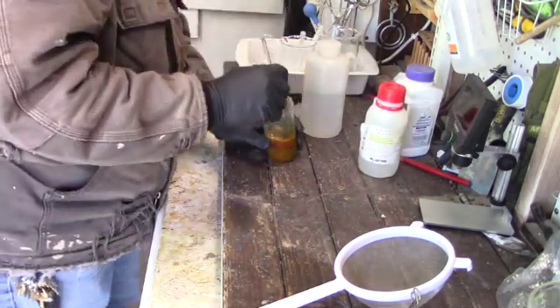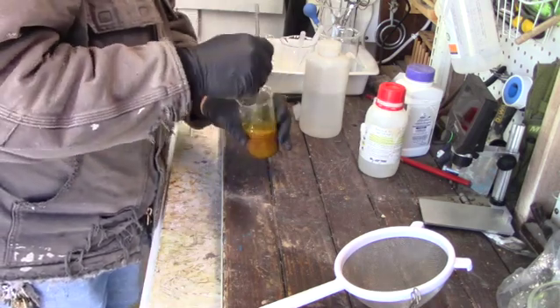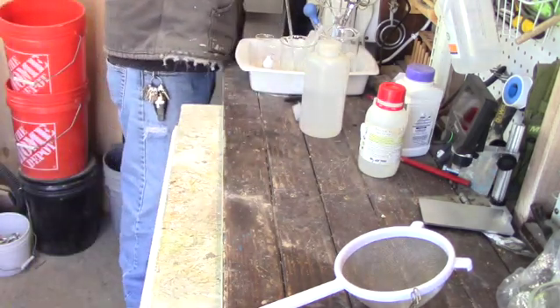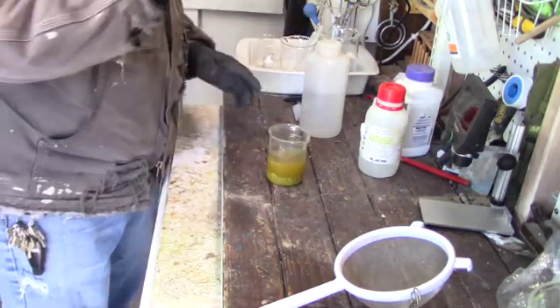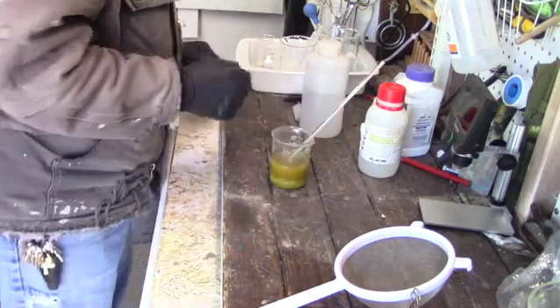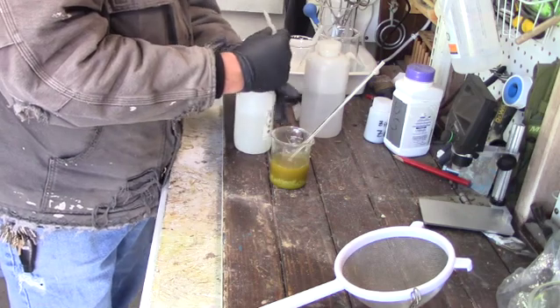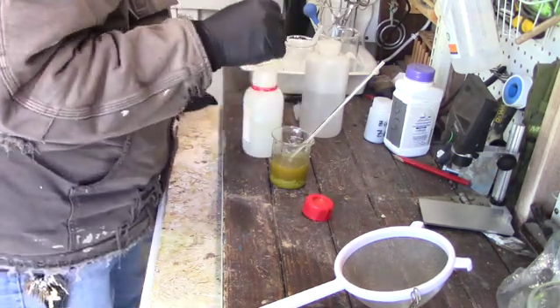Throughout this procedure, I frequently stirred the solutions to make sure that nothing got trapped under the gravel at the bottom — we wanted to make sure we got all we could. Now this is bad lab practice: you do not leave a utensil sticking out of a beaker of acid. It makes it very easy to tip over. I didn't do it this time, but give me a chance.